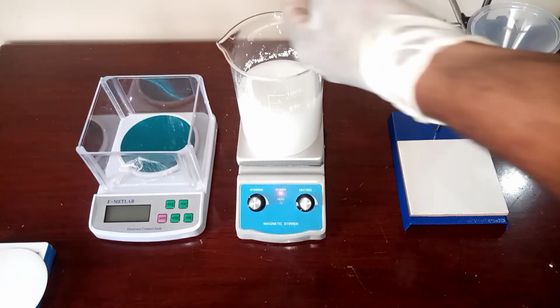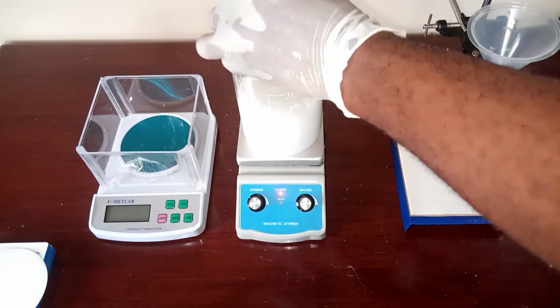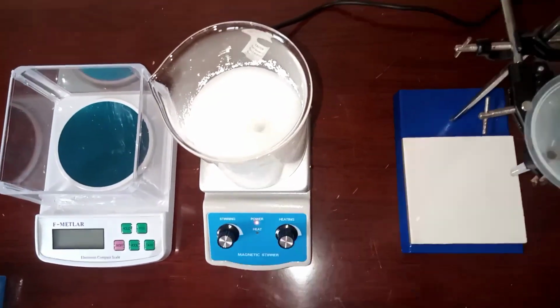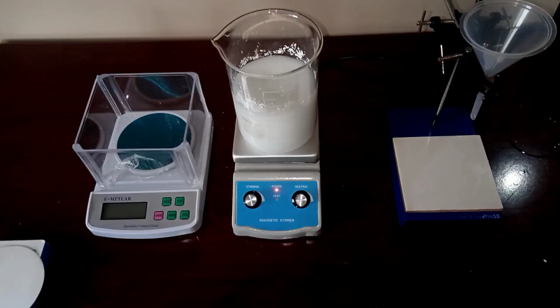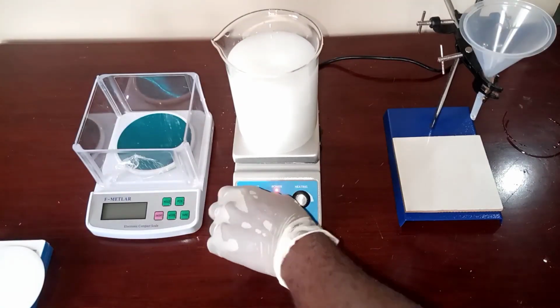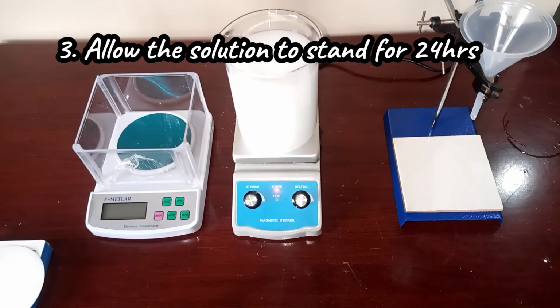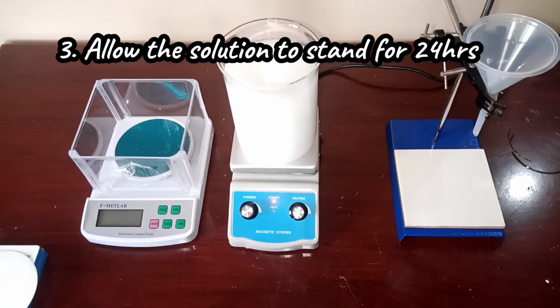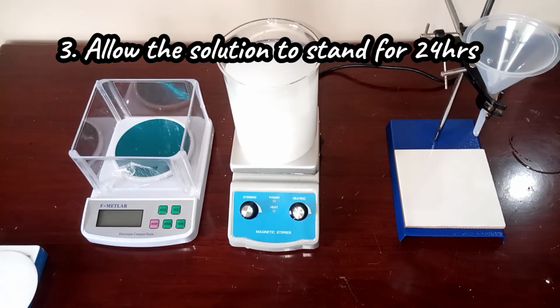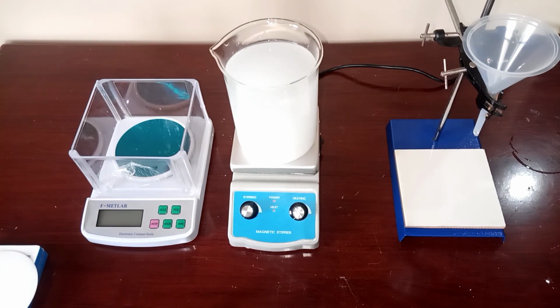And you observe that calcium hydroxide is sparingly soluble in water. You stir continuously for some minutes, and then you dilute to 1000 cm³ with distilled water while still stirring for some minutes. When you're done with that, you allow the solution to stand for 24 hours. This is to ensure that the calcium hydroxide dissolves properly and the solute will settle down to the bottom of the beaker, and then you decant the top, the clear solution of it, which is your lime water.